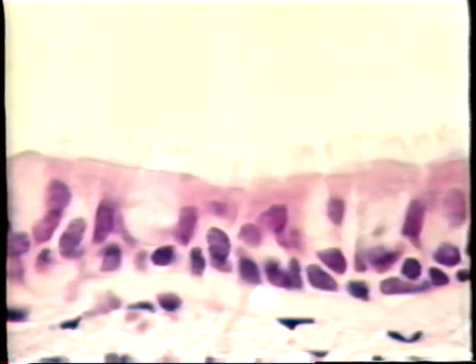And it's characterized by having cells whose nuclei lie at different levels. There's a basal cell, for example, here, whose nucleus is right on the basement membrane. This is the nucleus of a ciliated cell, which is up sort of amidships in the epithelium. And this is the nucleus of a goblet cell here. Remember that each of these cells contacts the basement membrane, and that's why it's really a simple epithelium. It's called a pseudostratified epithelium because the nuclei at different levels give it a false appearance of stratification.